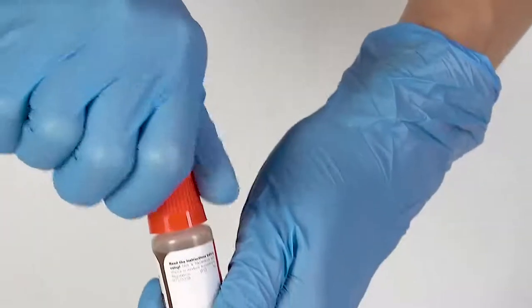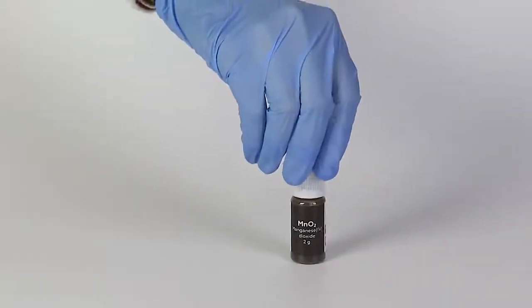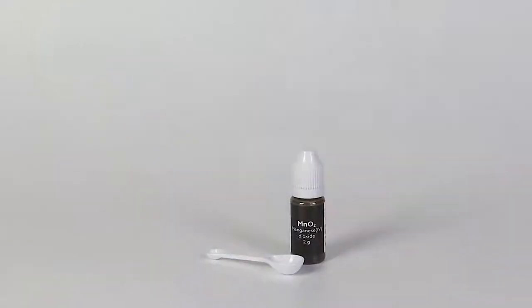To open a bottle containing a reagent, push the cap down and turn it. For the Burning in Pure Oxygen experiment, you will need the manganese dioxide and a measuring spoon. From the starter kit, you will need the flask and the funnel.